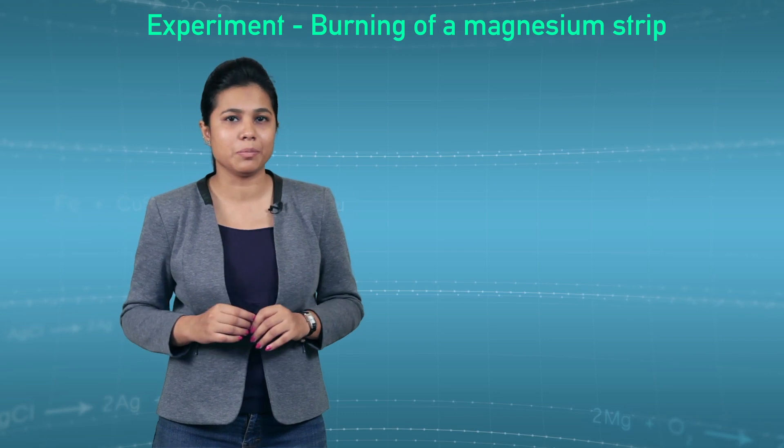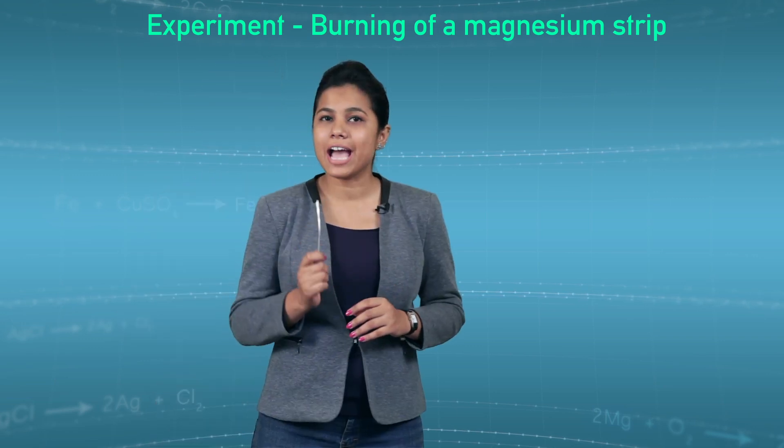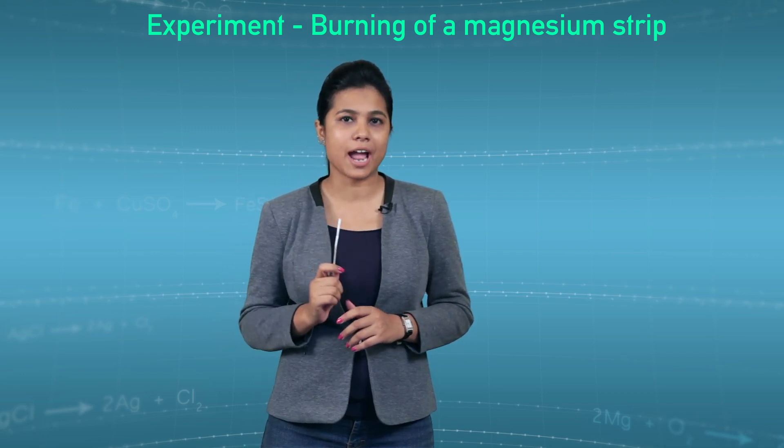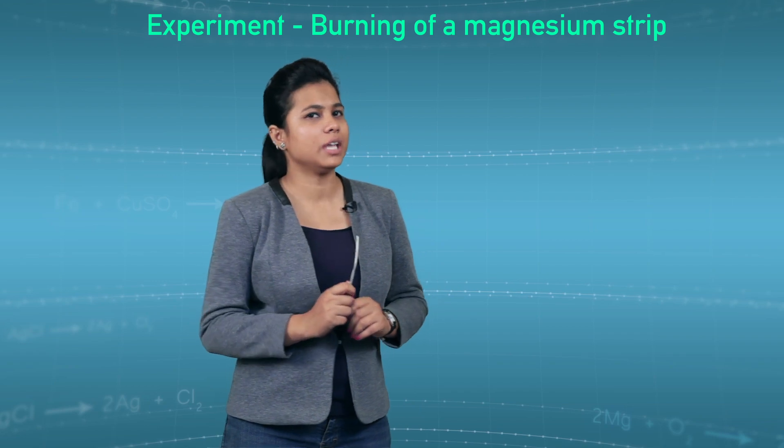Let's perform the first simple experiment which is burning of magnesium strip. I have a magnesium strip in my hand which we are going to use in this activity. So let's begin with the activity.